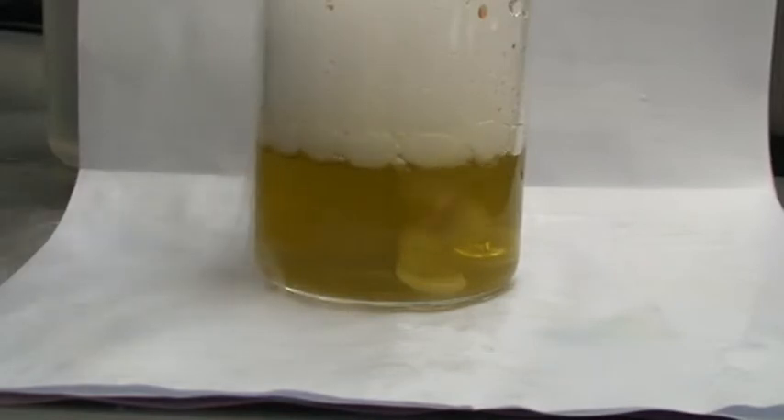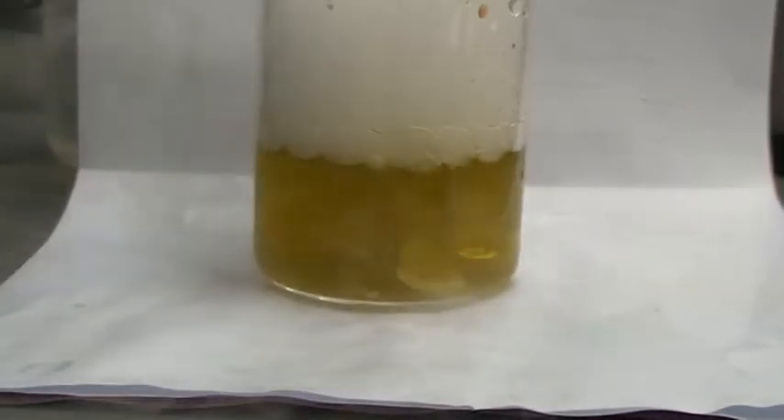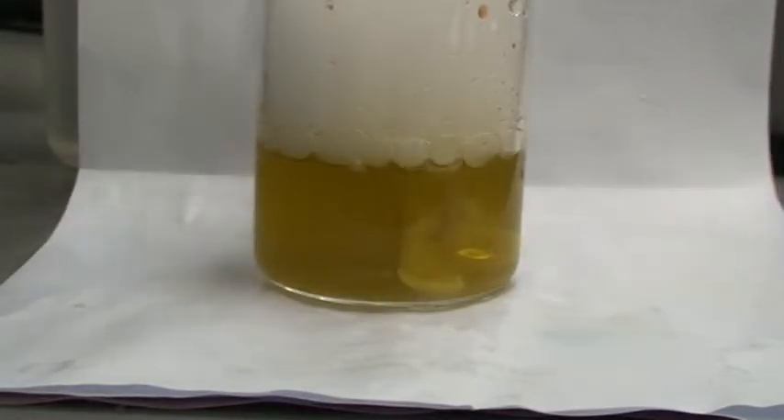You could actually put in phenolphthalein. If you put in phenolphthalein, it will start as pink in the calcium hydroxide lime water, and then after that change to colorless. If we have some more dry ice, we will do that afterwards.